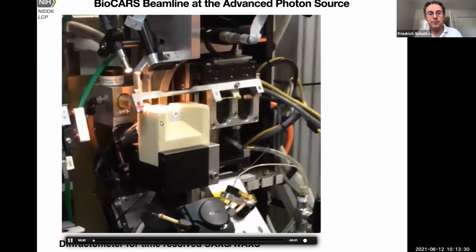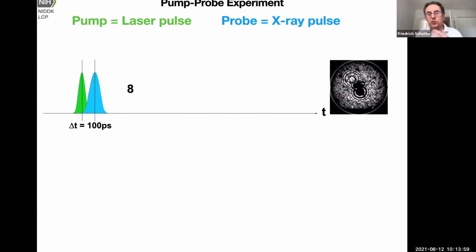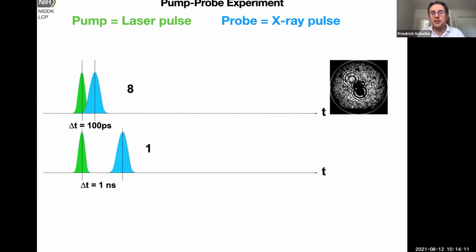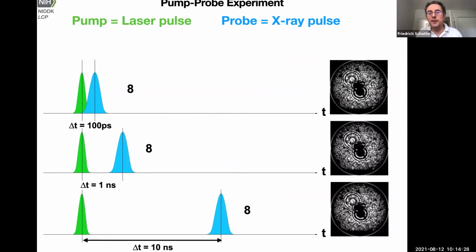and then rapidly retracting. So the key to this experiment is to have two pulses, a pump laser pulse and a probe X-ray pulse, that are timed precisely. So we have an electronic system that can set and change the time delay between laser and X-rays precisely. So we fire, for example, 8 of these pulses, and then read out the detector to accumulate more signal and improve signal to noise, and then we electronically tune the time delay to the next time point. Say 1 nanosecond delay. Repeat this 8 times, read out the detector, and then go to the next time delay, 10 nanoseconds. Accumulate and then read out. So this is how we make movies of biomolecules in action.